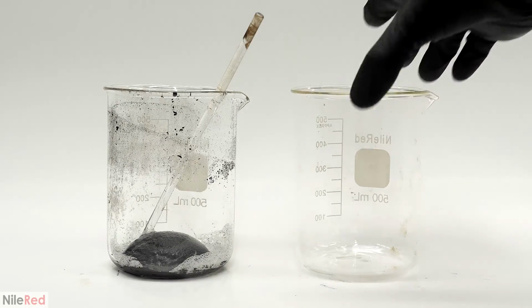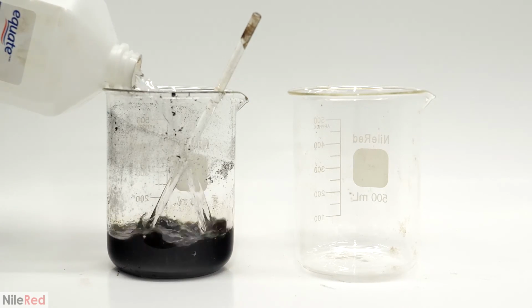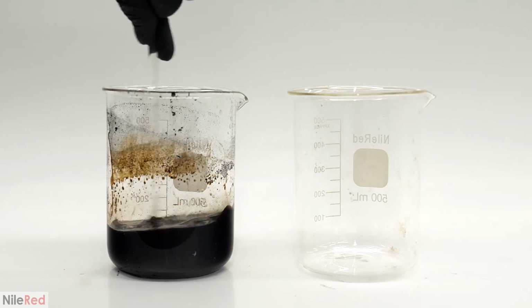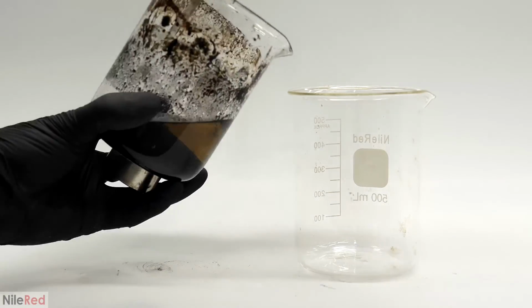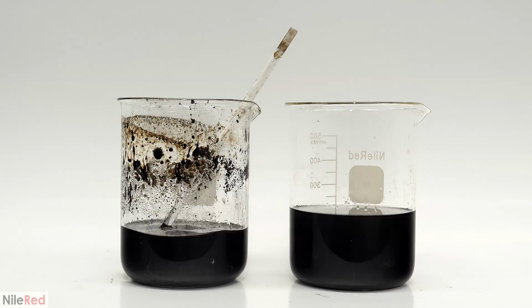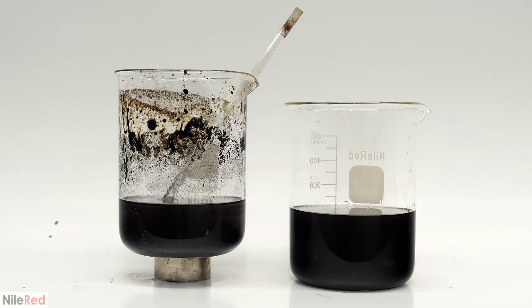What I did here was pretty much exactly the same, except I found that with the first couple washings with the alcohol, it always takes a bit longer for the magnetite to separate. So for these, instead of waiting about 5 seconds before dumping it off, I waited about 15 or so. By the third one though, it was a lot quicker, and the alcohol was also pretty much completely colorless.